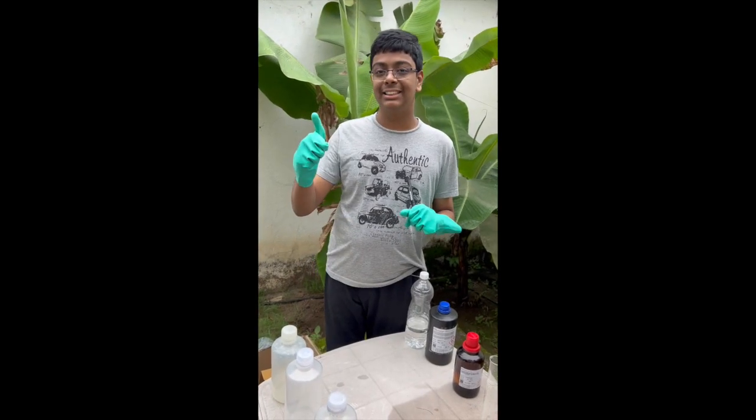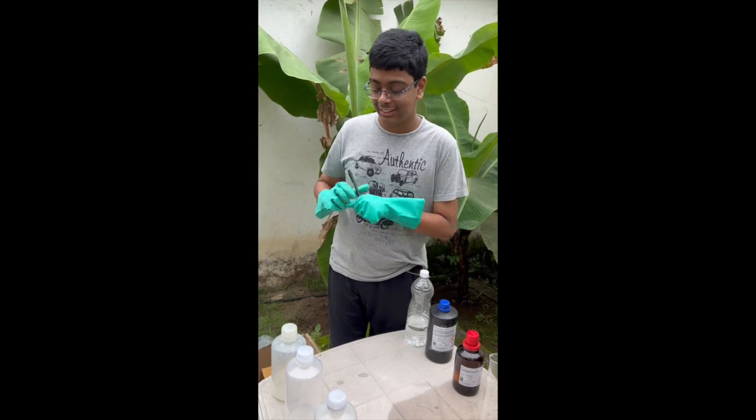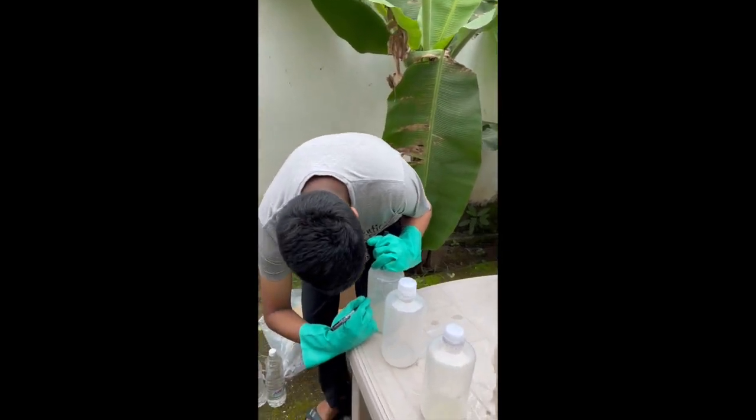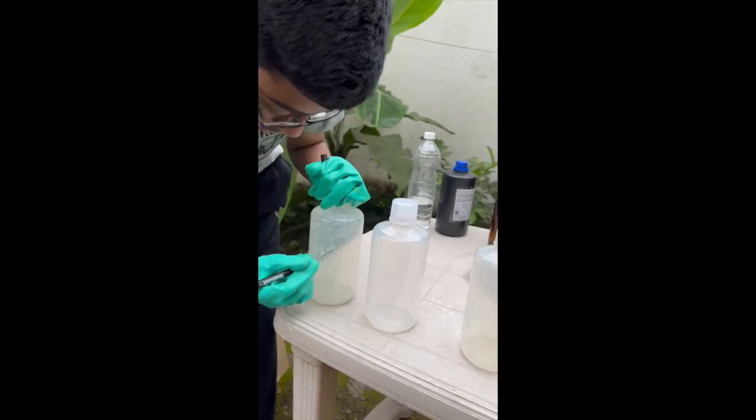This is me trying to mix some chemicals with no previous experience or any special knowledge. So, wish me luck, please.